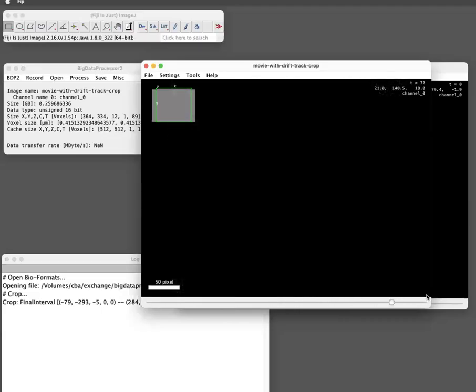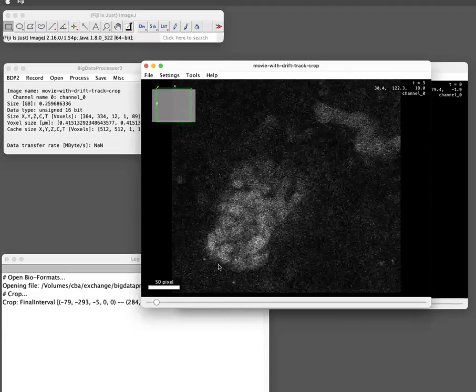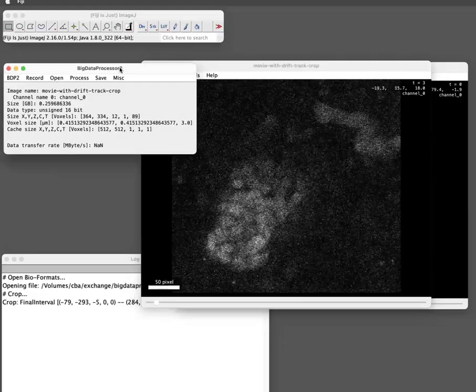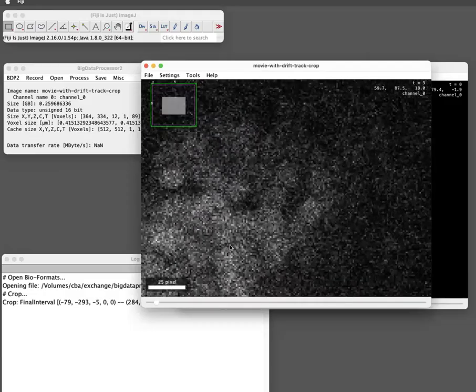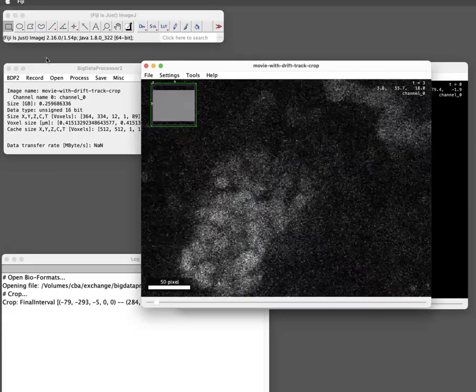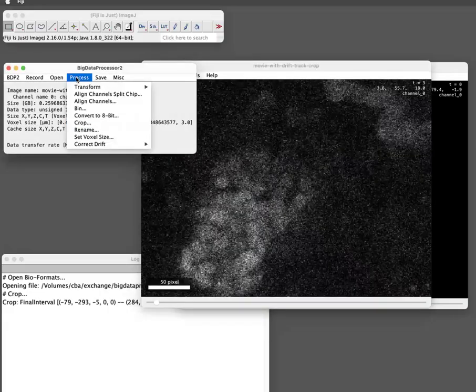And that looks now actually quite nice. So the tip is more or less just staying here and we only have relevant data. In fact, maybe one more thing. This is a bit noisy, this movie. So I don't think I want to keep all this data. So I just show you one more thing you can do.